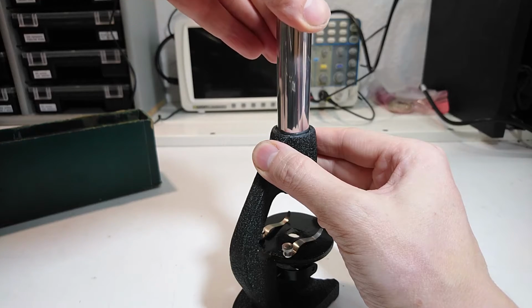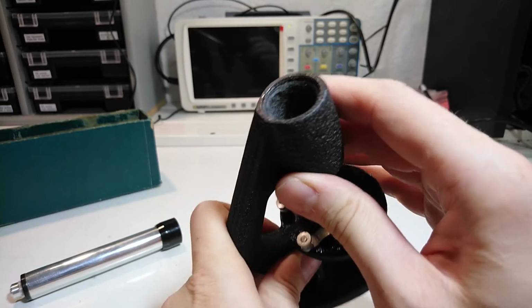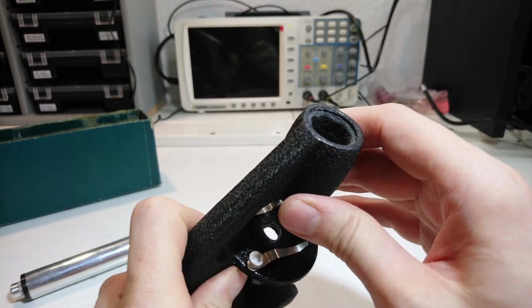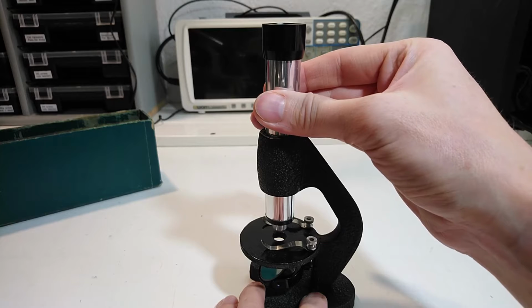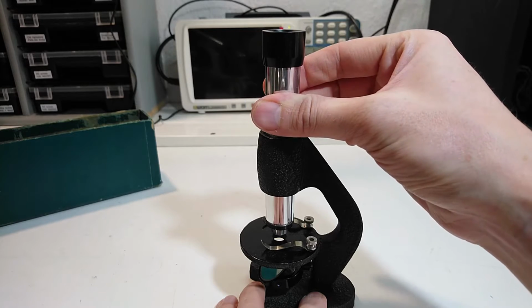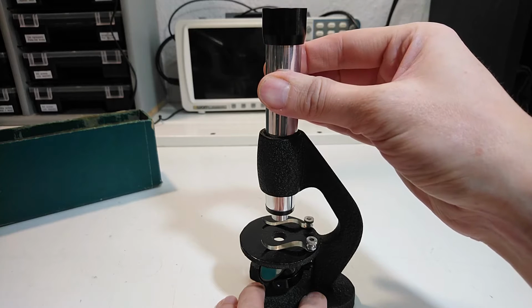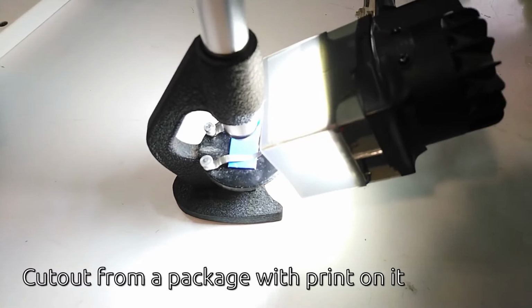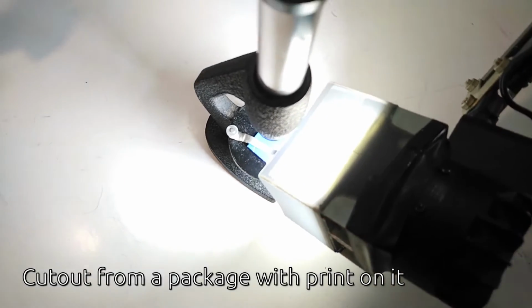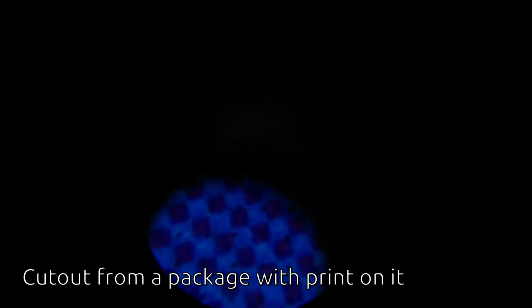The actual microscope tube is only held in position by a felt lining in the hole, and there is no focus knob. Instead, the tube is moved up and down by hand to focus. The magnification is a bit above 100 times, which should be enough to see quite some interesting stuff. A first look through the microscope tells me that the lenses are not scratched and work fine.